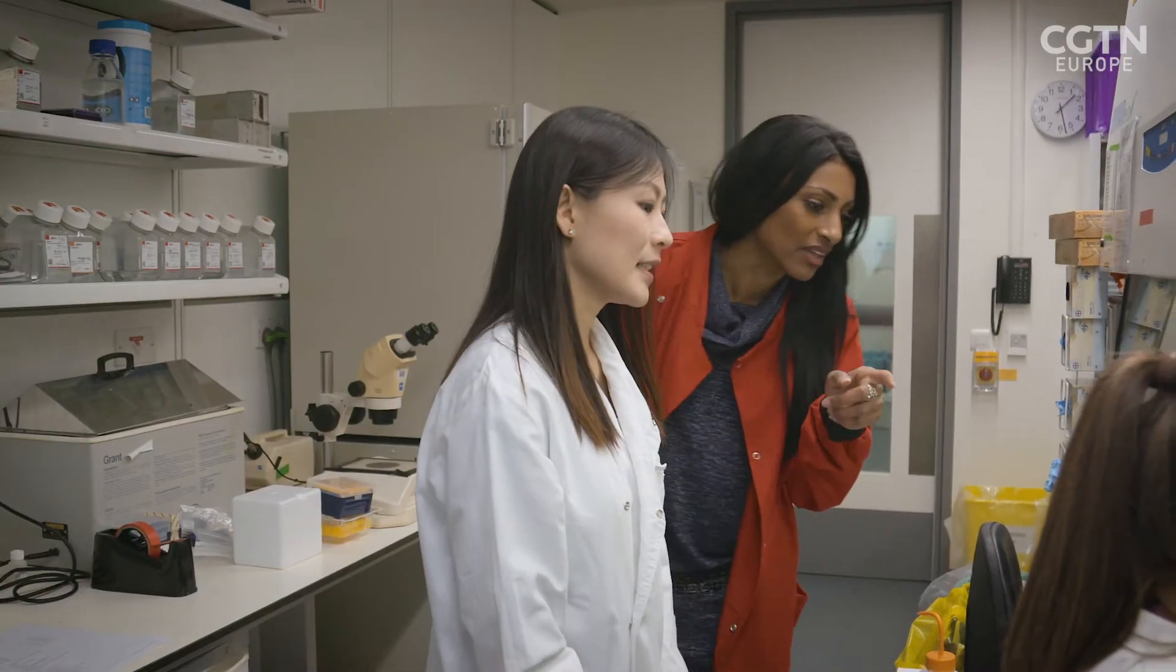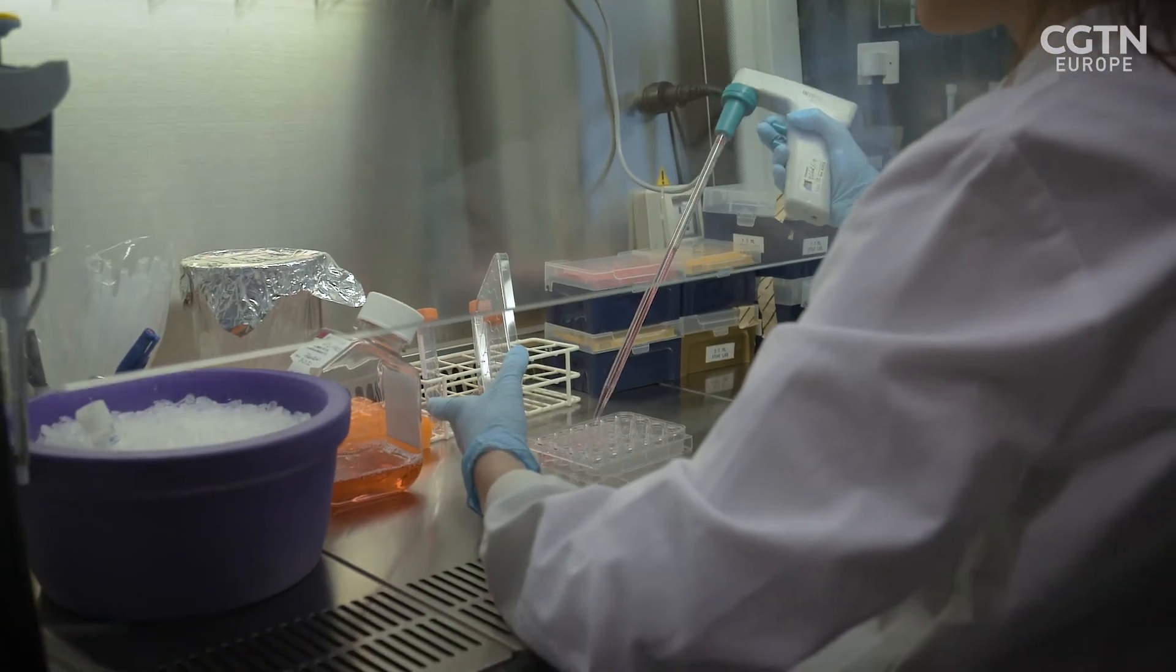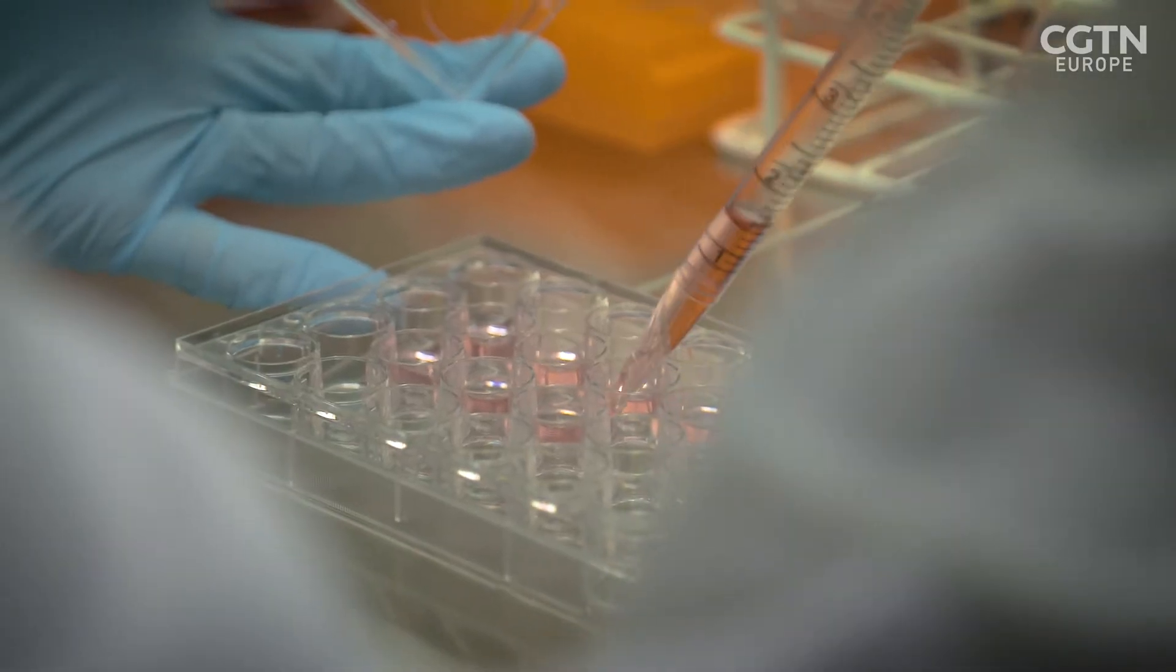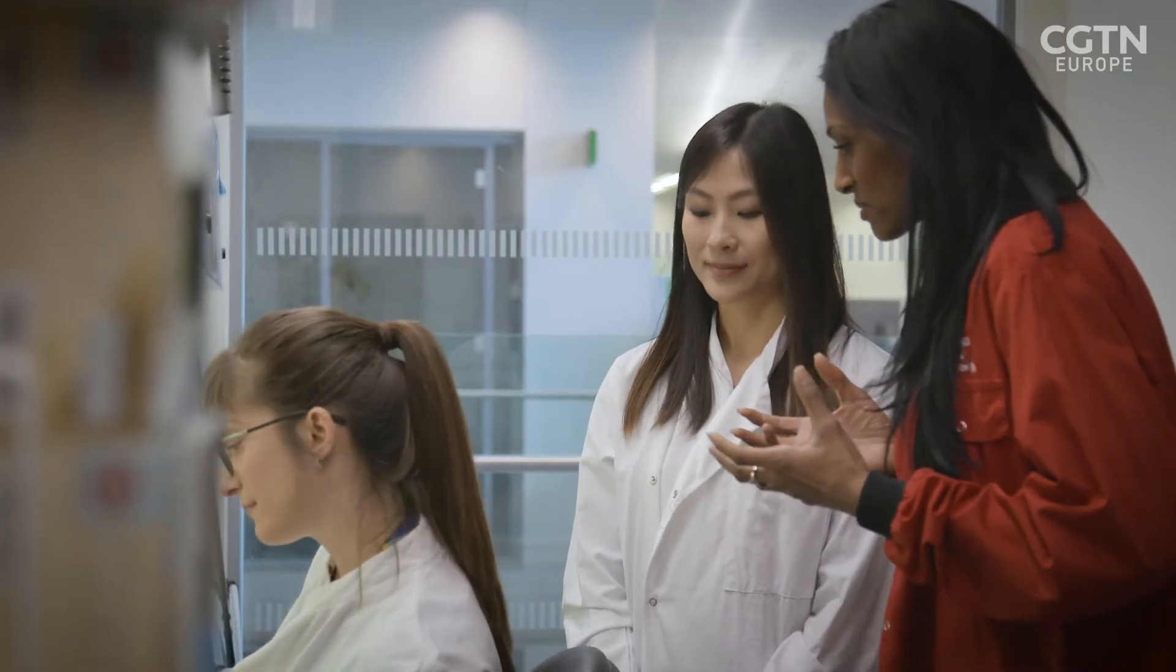What's she doing here then? Usually you need to give them nutrients to grow. Essentially Claudia is feeding the stem cells. Exactly.